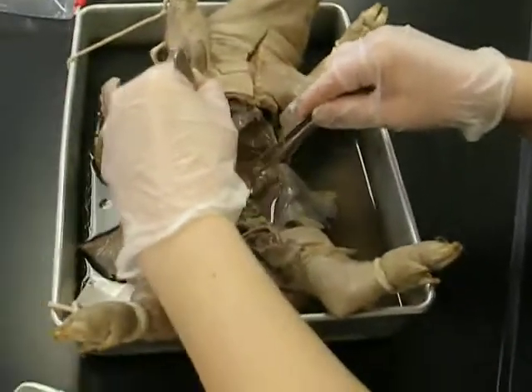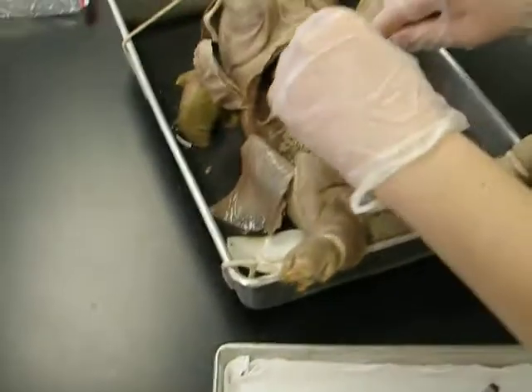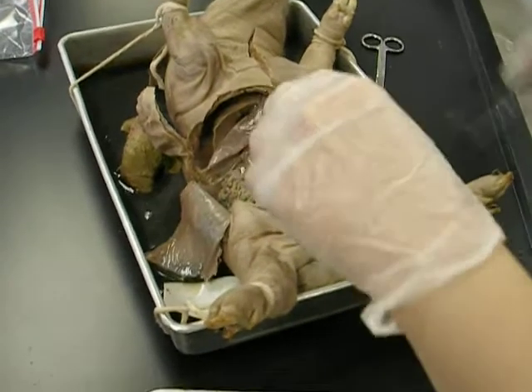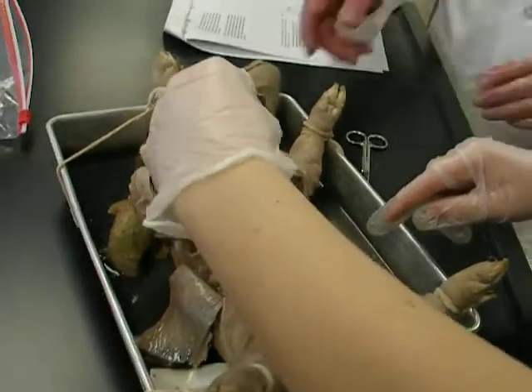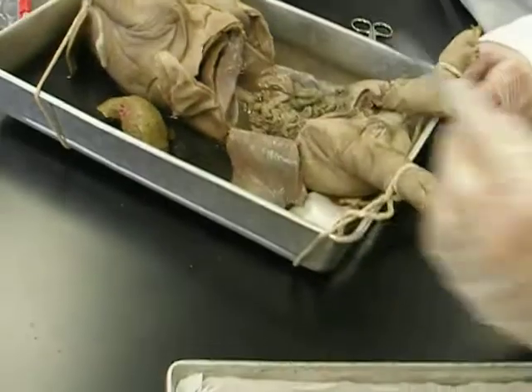What's that? Who's in your group? Whoa, nasty. Oh! That's not good. It wasn't supposed to eat. I think his mama was sneaking in a little more than... amniotic fluid. It's not... oh, I'm sorry. So what's that? Can you trace us out? It wasn't supposed to be eating. It gets mommy's something other than amniotic fluid. What is that green stuff? Yeah, what is it?